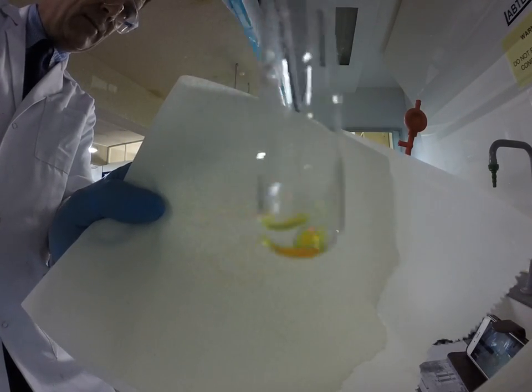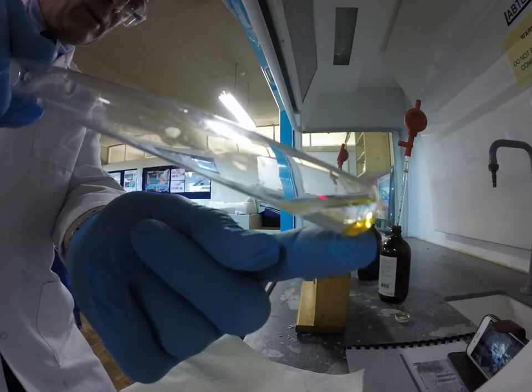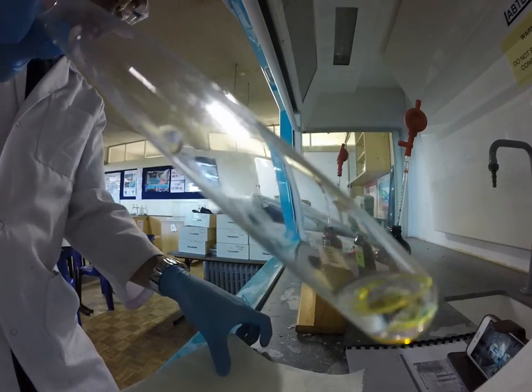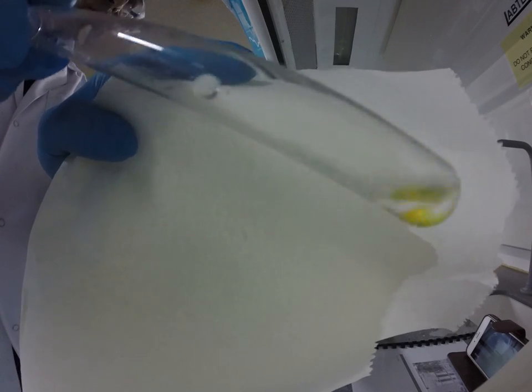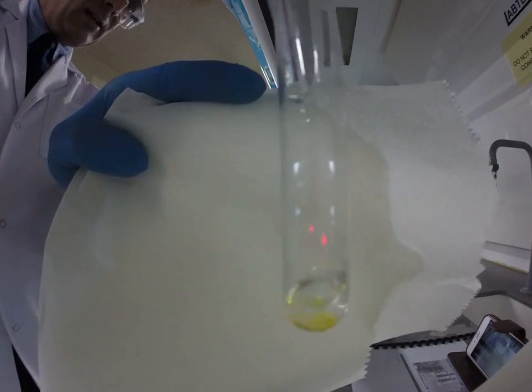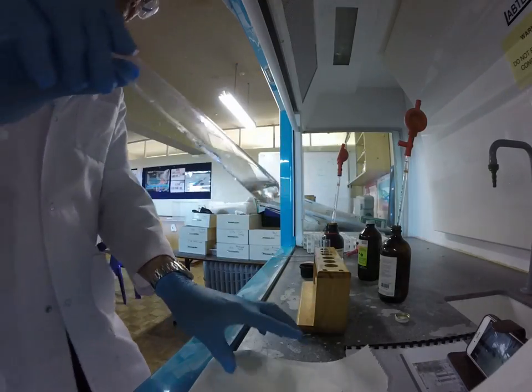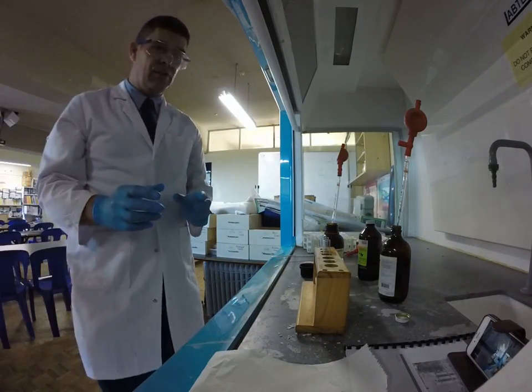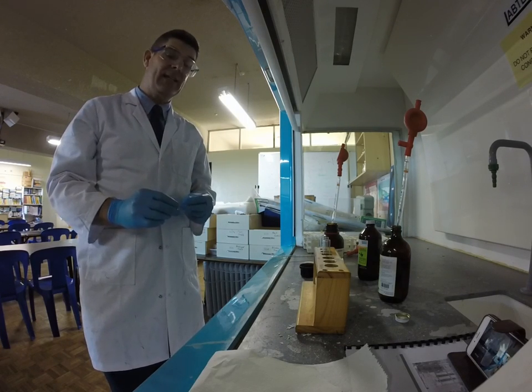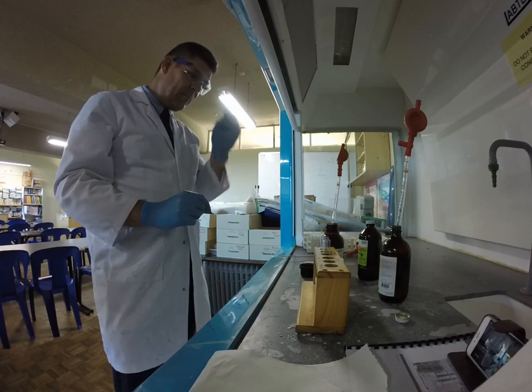What you can see happening is the bromine water is sitting at the bottom of the test tube. There's a little bit of colour still there in the aqueous layer, but very quickly it moves into the organic layer — which is where the cyclohexene is — and it disappears. If I give it a little shake to mix it a bit better, you can see pretty much all that colour is just about gone. That's an immediate reaction. It's called an addition reaction, and it occurs when we have an unsaturated hydrocarbon with a double bond, like cyclohexene. The bromine water is adding across that double bond and the colour disappears.